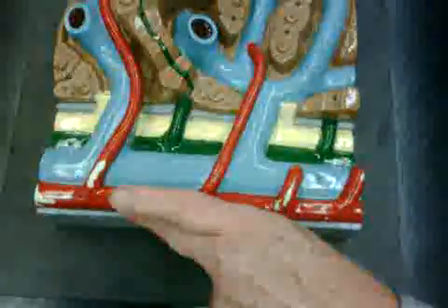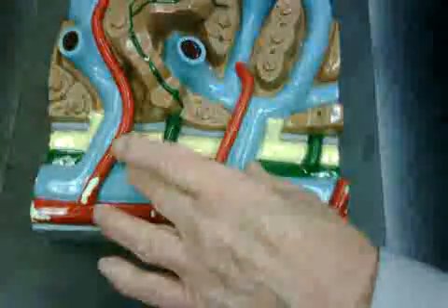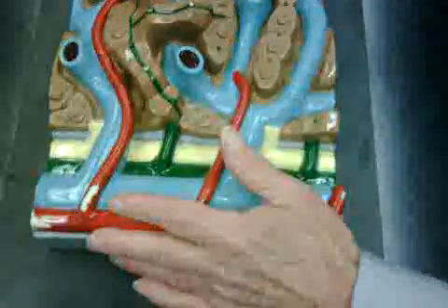Basically, the blood comes in to drain through this liver lobe, and it comes in, of course, from the hepatic portal vein and from the hepatic artery. So these vessels here, this one comes from the hepatic artery, this one comes from the hepatic portal vein. The principal blood supply is from the hepatic portal vein. Relatively little blood comes from the hepatic artery, because it's much smaller.